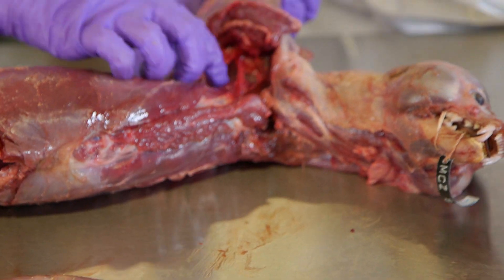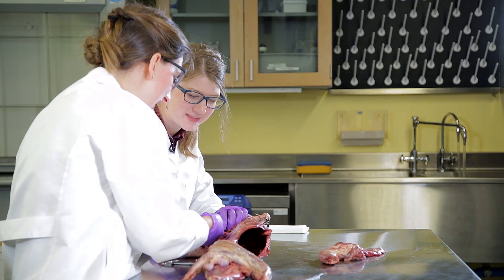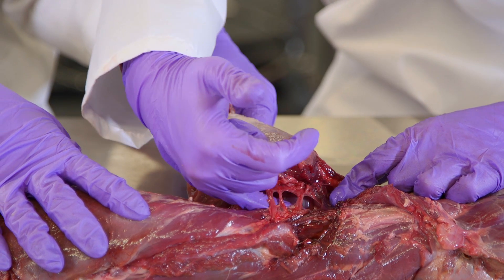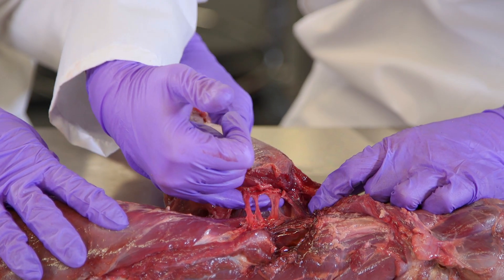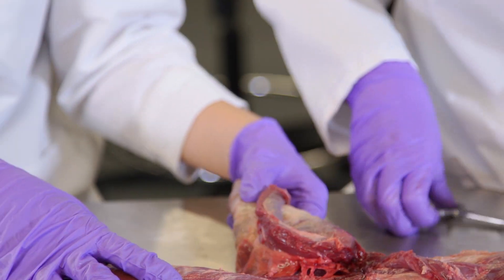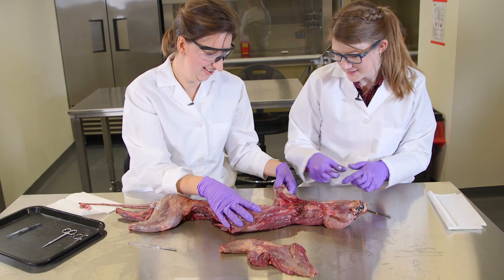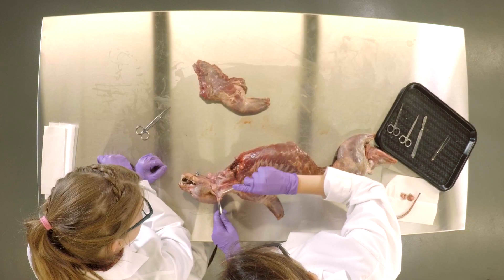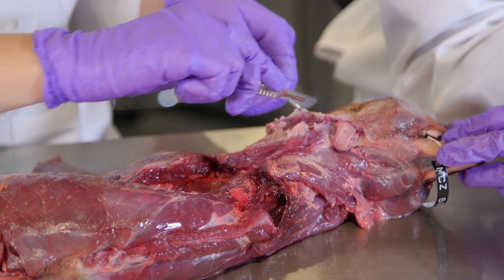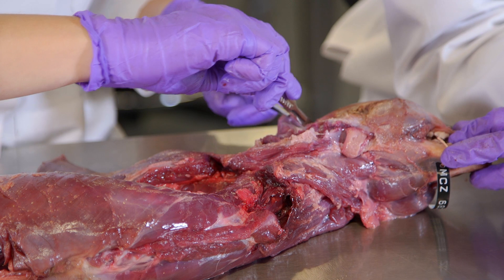What's holding it on down here still is the serratus muscles. And what we have over here is the brachial plexus — they are like data cables, communicating information from the brain. There's also a web of muscle that runs all the way over the neck called the platysma, which is one of the muscles that helps open the jaw. Whales have really giant ones all over — it helps them to push the water when they gulp feed, like baleen whales.